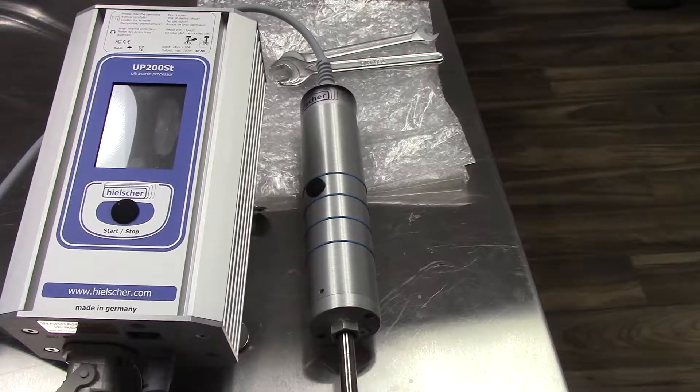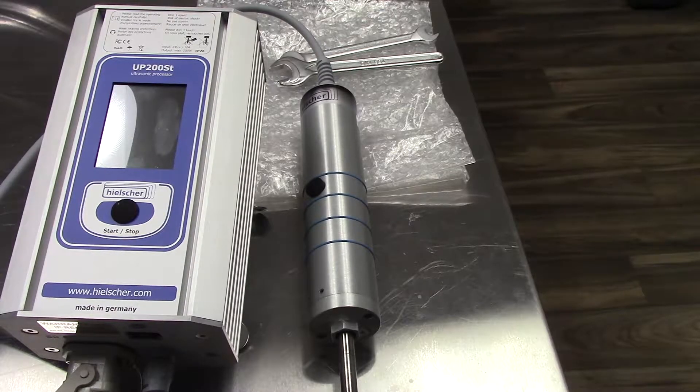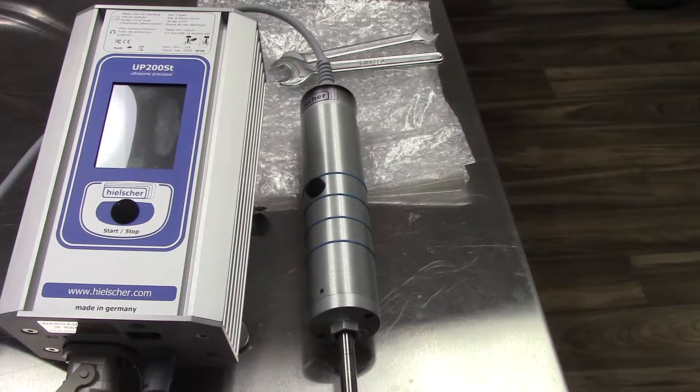In today's video, we'll be dismounting and mounting the sonotrode. The two tools required are located within the case the instrument came in.